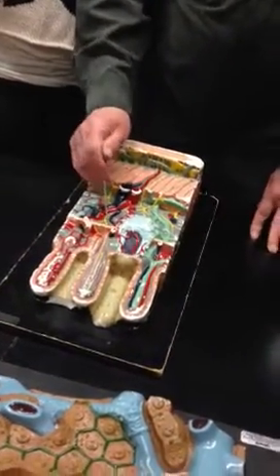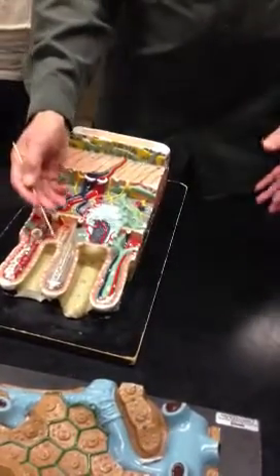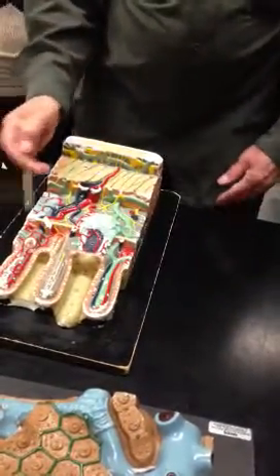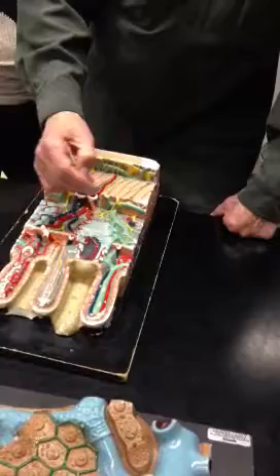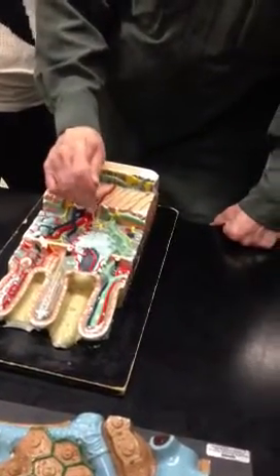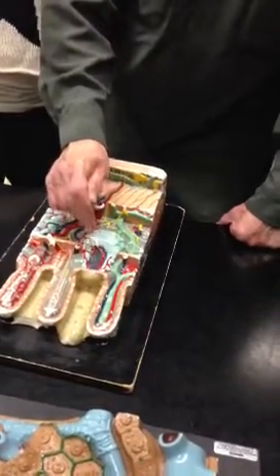So this is the muscularis mucosa, and these would be fibers of the muscularis mucosa. If I label this and you just tell me muscularis mucosa, I'll be happy. This gland over here is meant to be a lymph node. It's not really a gland, or maybe it's a lymph gland. It's a lymph node. And all of these dark purple things inside here are lymphocytes.